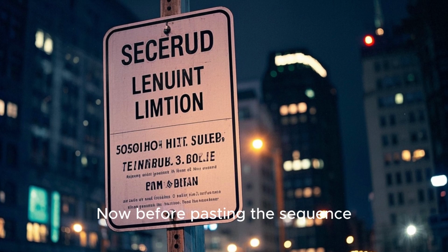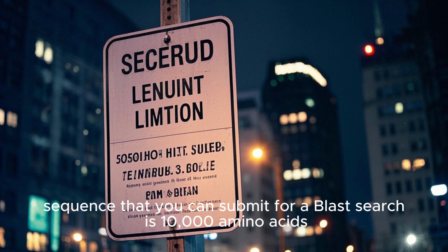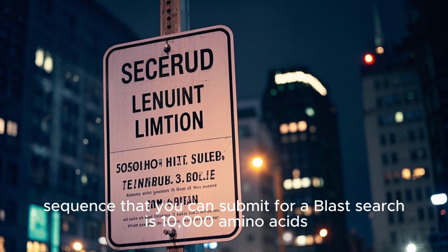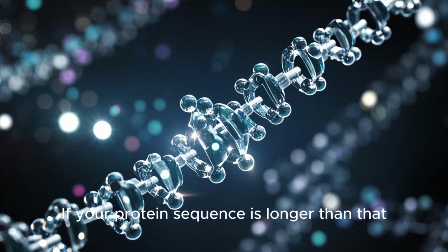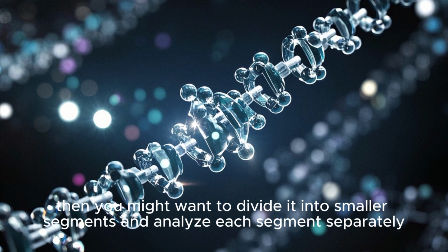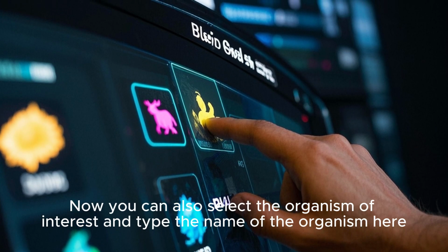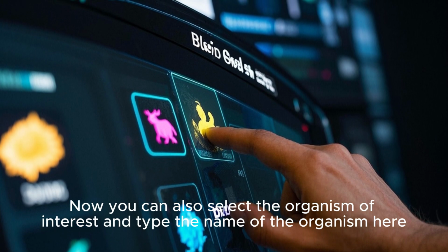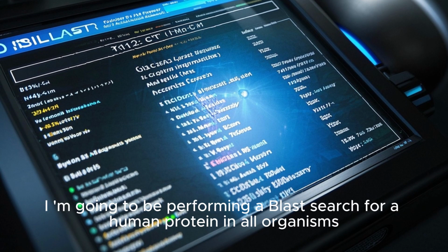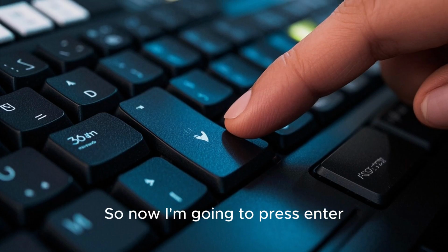Now, before pasting the sequence, you should know that the maximum length of a protein sequence that you can submit for a BLAST search is 10,000 amino acids. If your protein sequence is longer than that, then you might want to divide it into smaller segments and analyze each segment separately. Now you can also select the organism of interest and type the name of the organism here. For today, I'm not going to select anything because I'm going to be performing a BLAST search for a human protein in all organisms. So now I'm going to press enter.